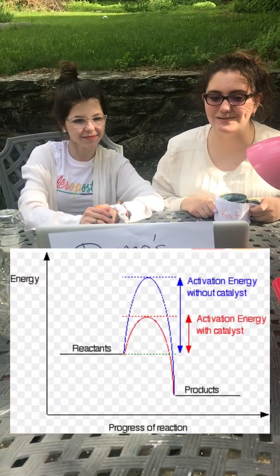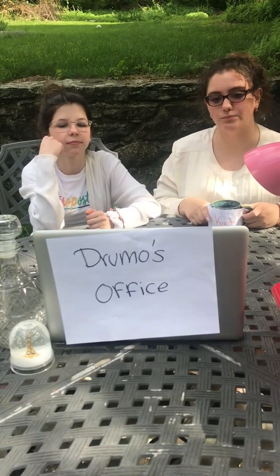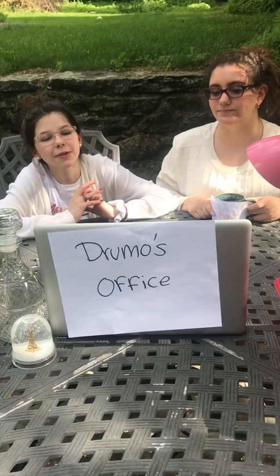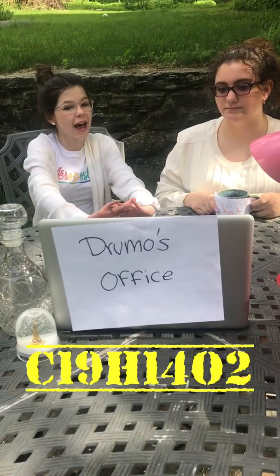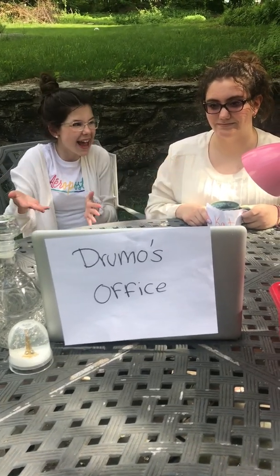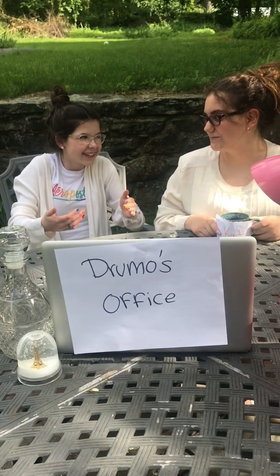A catalyst speeds up the overall time it takes for a chemical reaction to occur without tampering its products. For our first experiment, we will be using yeast, which contains an enzyme called catalase. Ha ha ha! Get it, cat? Cat? A lace? No.